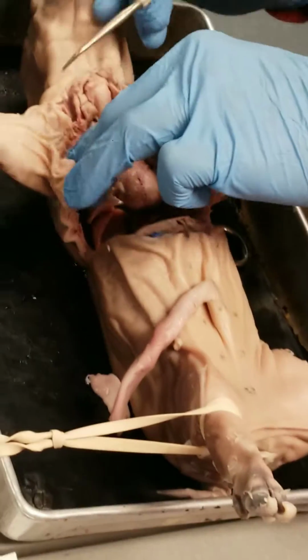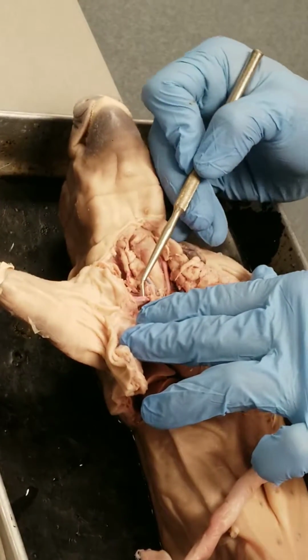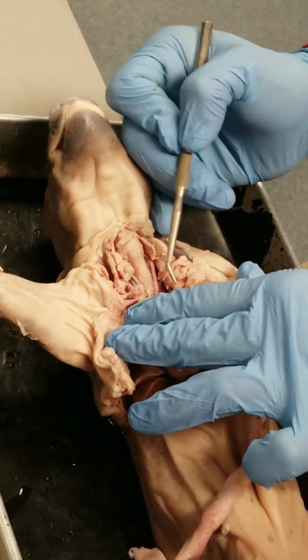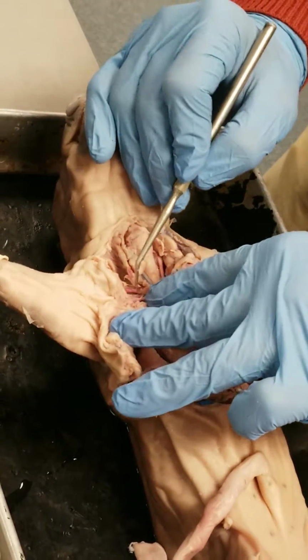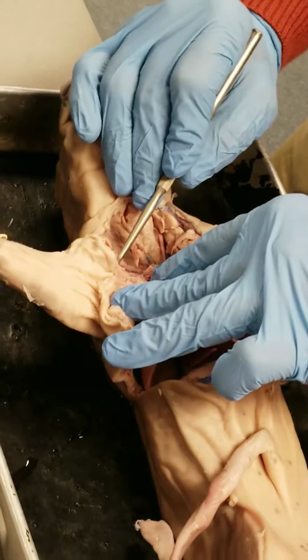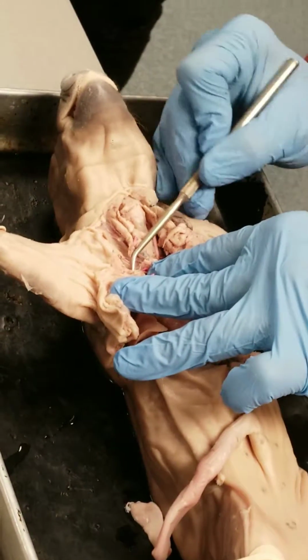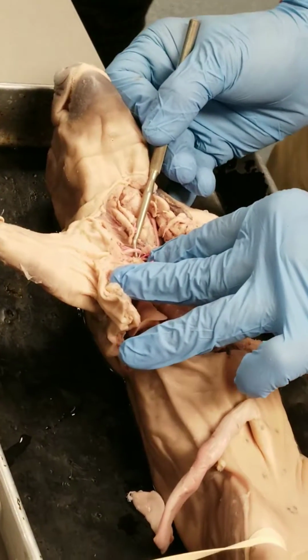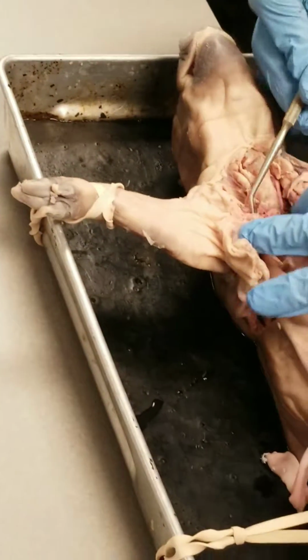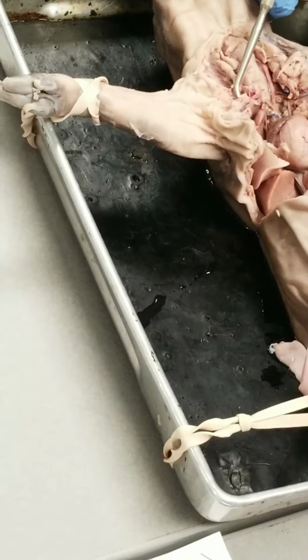So the other thing that you'll notice when you find the axillary artery, and again, some of these smaller vessels, little small vessel, not important. You can pull through that. We're trying to preserve the big one. So don't pull through anything until you're certain it's not something that you're supposed to know. So this larger vessel here is the axillary artery. And again, if I clean this up a little bit more, you'll be able to see it more clearly coming up and over.